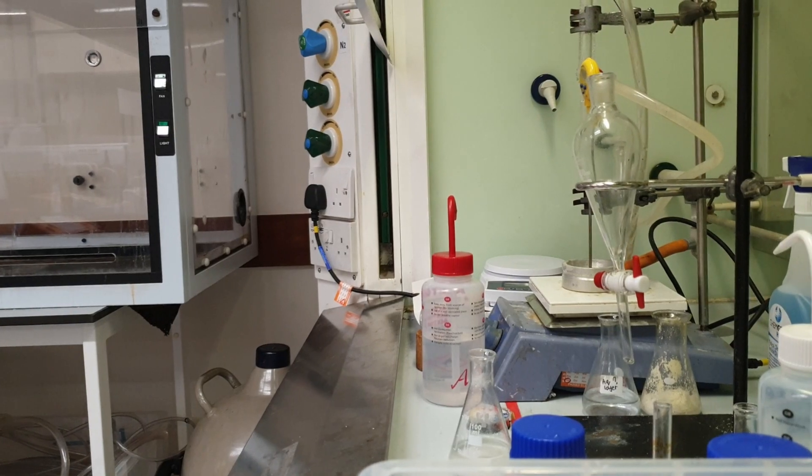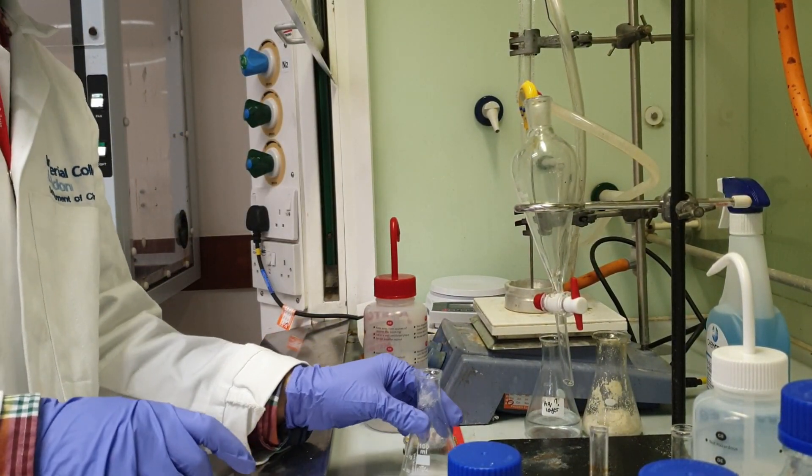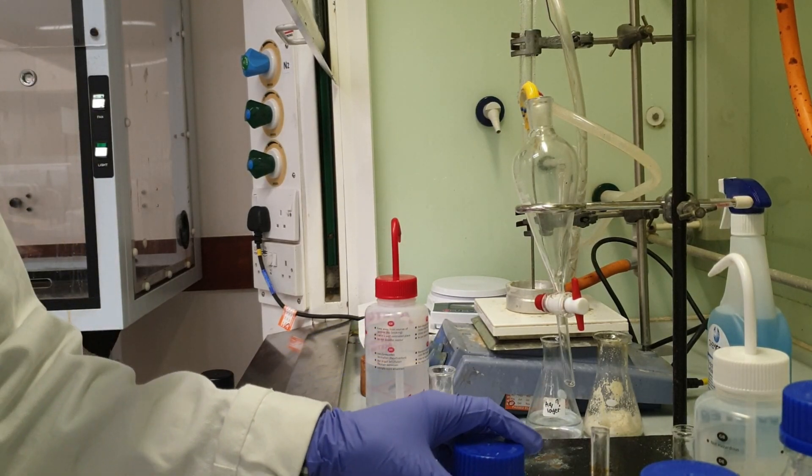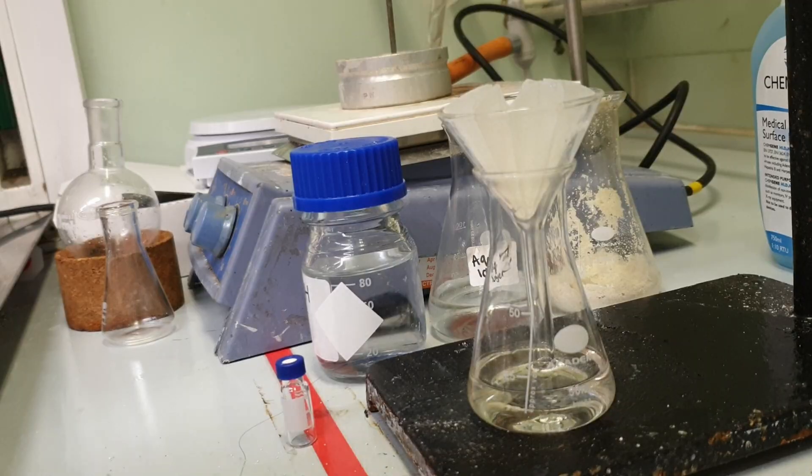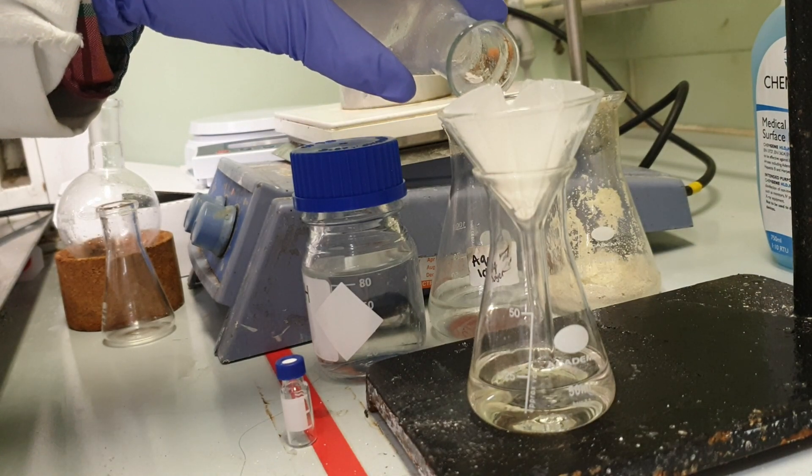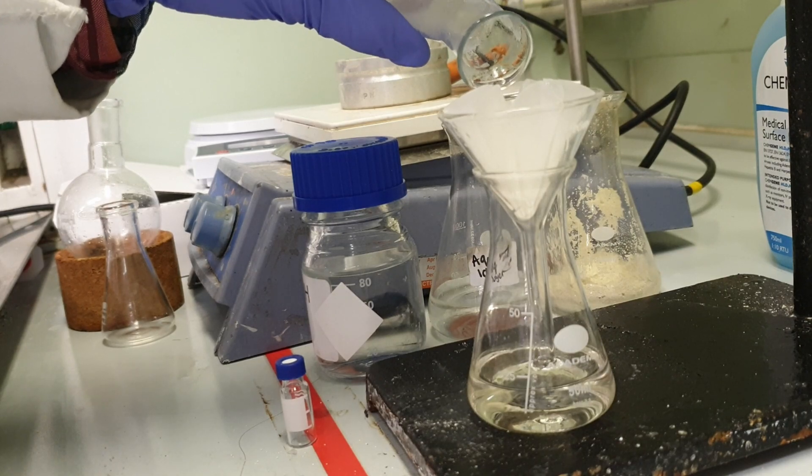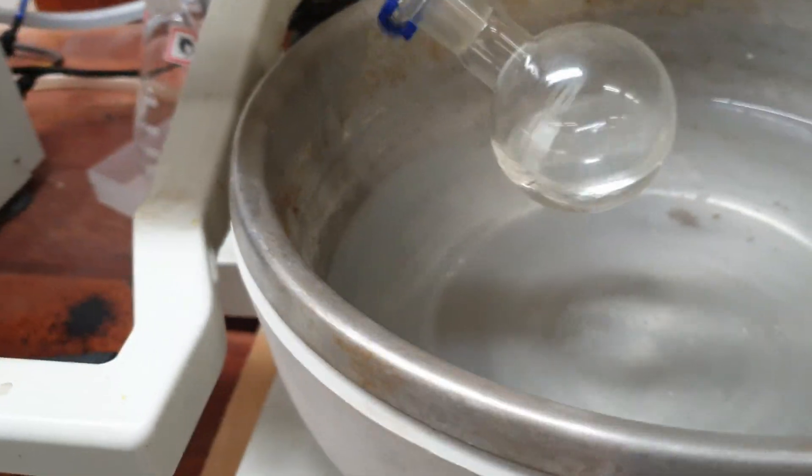I'm ready to do gravity filtration with my included filter paper. I just need to give my funnel a bit of a wash. One performs gravity filtration when they want to remove a solid from a liquid and keep the liquid as pure as possible.